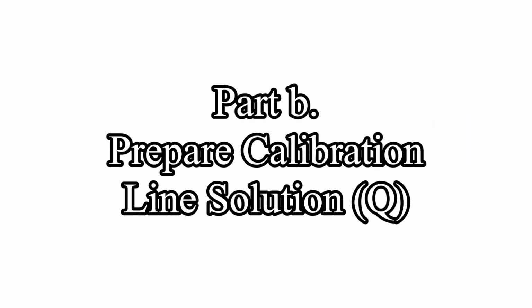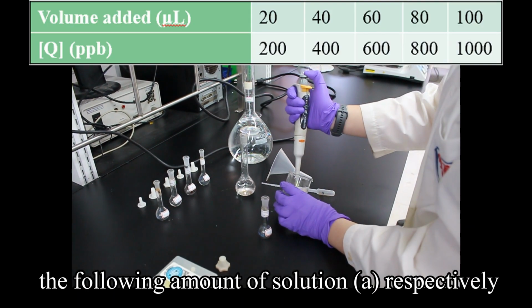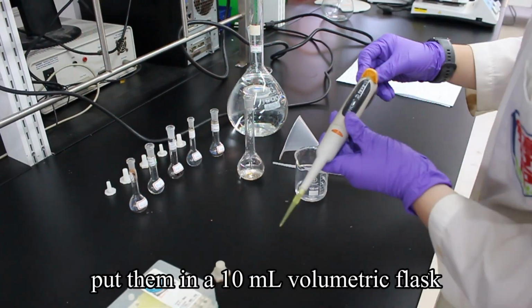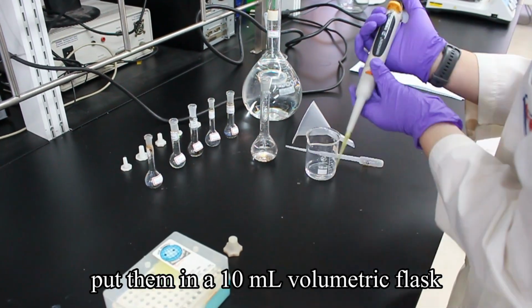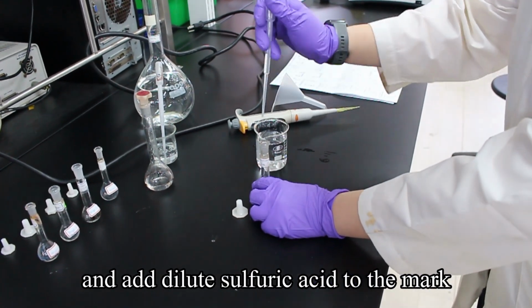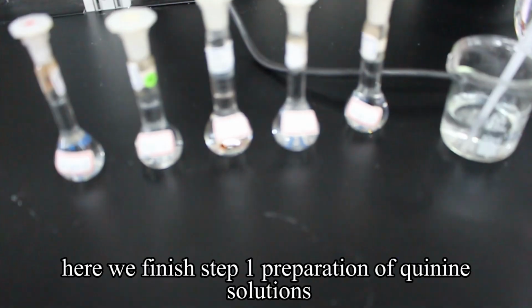Part B. Prepare calibration line solutions. Use a micropipette to take the following amounts of solution A, respectively. Put them in 10 ml volumetric flasks, and add dilute sulfuric acid to the mark. Mix well. Here we finish step 1, preparation of quinine solutions.